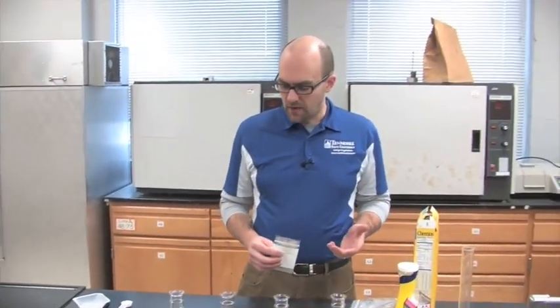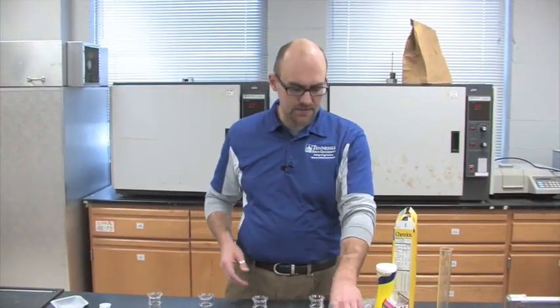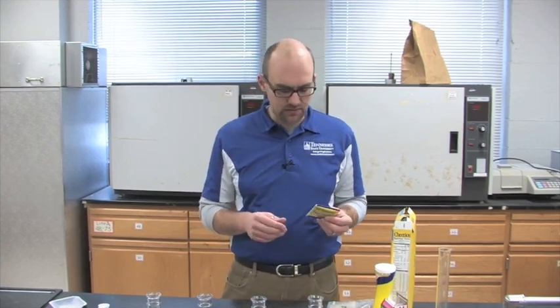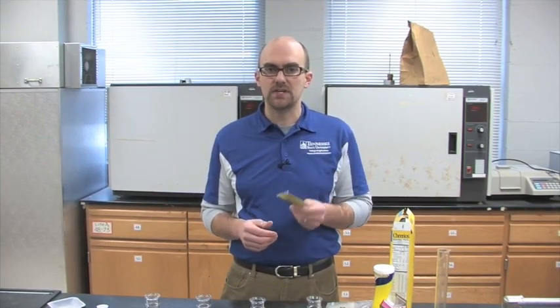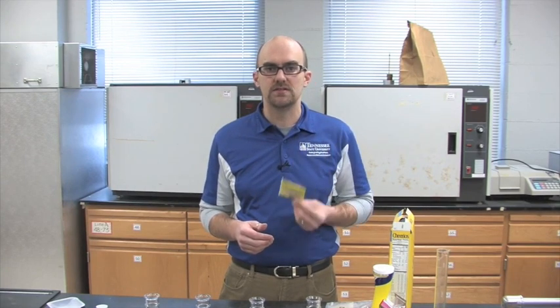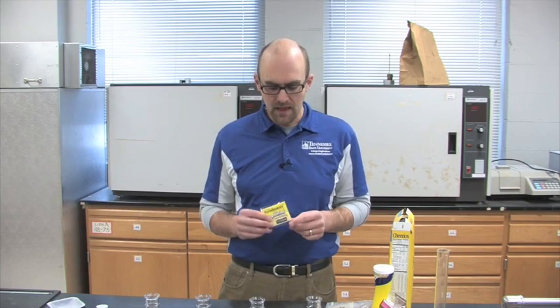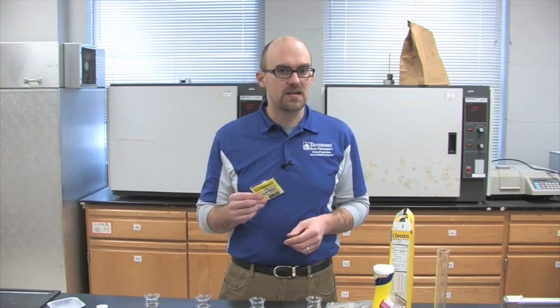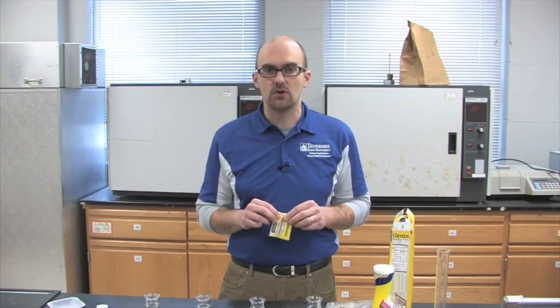Now that we've added eight grams of each of the different materials to their flasks, we're going to add the yeast. Each flask is going to get a packet of yeast. We're using rapid rise yeast, the same type you would use for baking bread, because the process is relatively similar. Each one of these packets has about seven grams of yeast, so each flask gets its own packet.